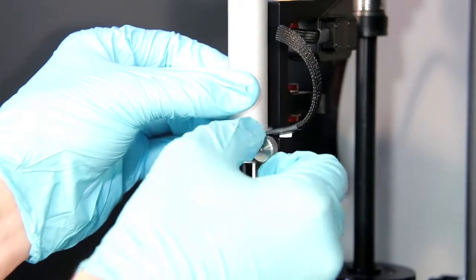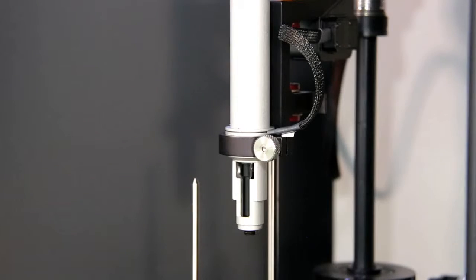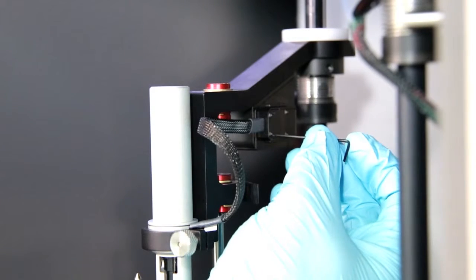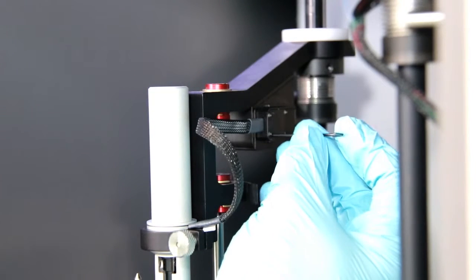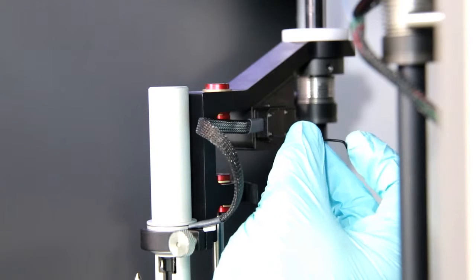Tighten the collar, and re-tighten these two small Allen screws with the wrench supplied with the instrument.